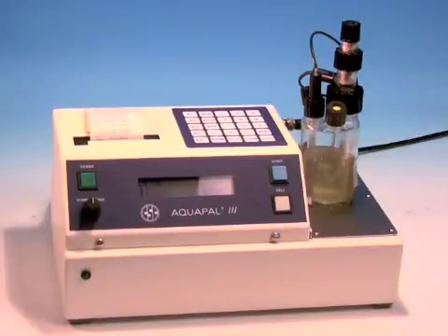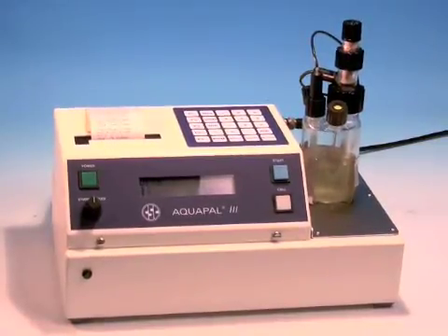Okay, this is the Aquapal 3 Coulometric Karl Fischer titrator and today we're running a new water standard, actually a water standard oil.